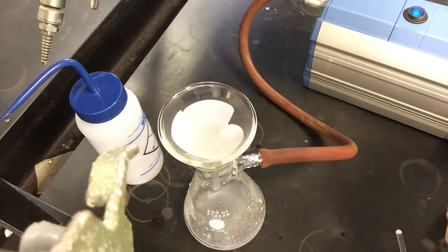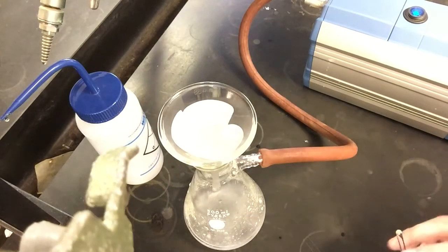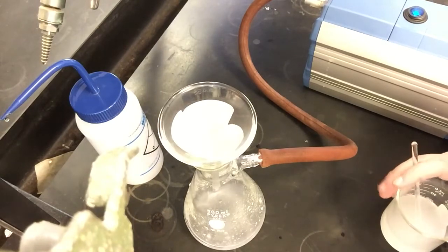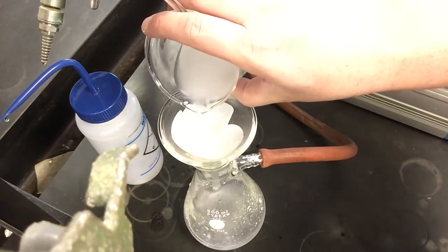There is some whiteness to it now, so there probably is a little bit of our solid that's not getting filtered out. That's okay. It's not really the end of the world here. If you were trying to be really accurate and get the best possible yield, we could probably do an extra filtration or two to make sure we get all of the solid out, or get better filter paper. I think there are some post-lab questions that may touch on why you might not get 100% yield, and this would be a good one to talk about during the filtration step. But I'm just going to keep my solution filtering.